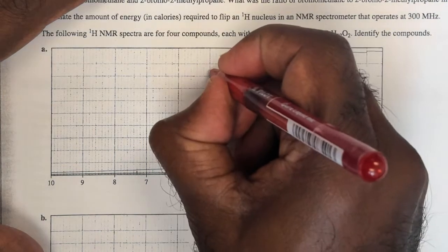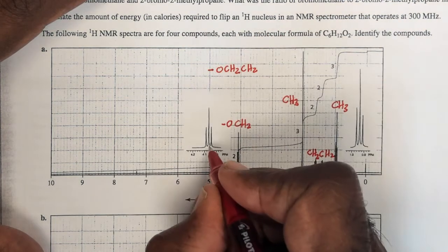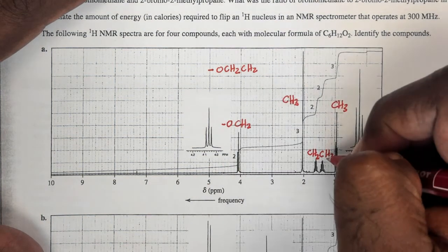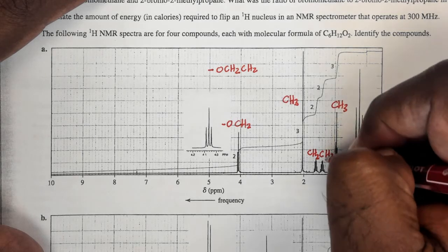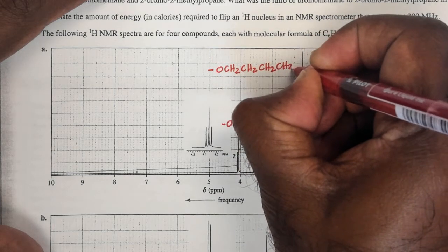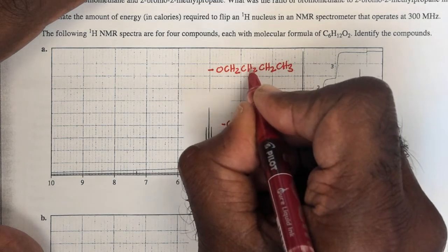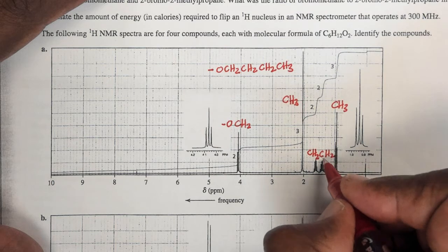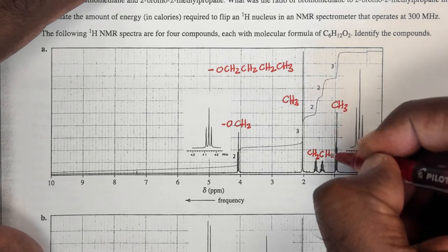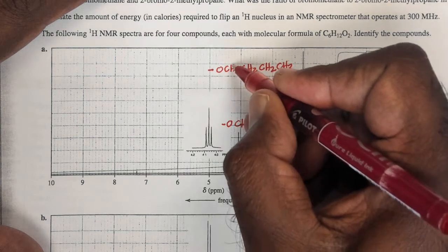So I have this fragment with the CH2 next to it to give me a triplet. I also have the CH3 next to a CH2 to give me another triplet. I have two CH2s here, so I'm going to put the CH2 next to a CH3. I could have put the CH3 here next to the CH2 and still got a triplet for this, but then I'd be out of sorts with the other CH2. So I'm going to get a CH3 and CH2 to give me this triplet, and then this OCH2 and the CH2 to give me another triplet for this.